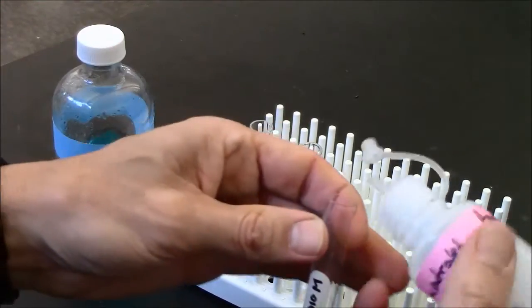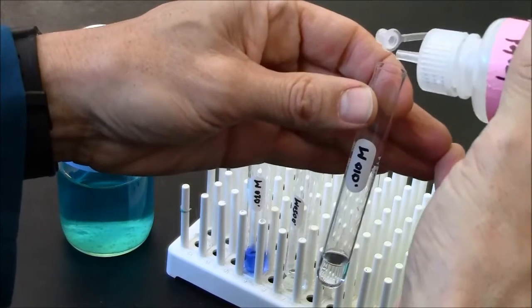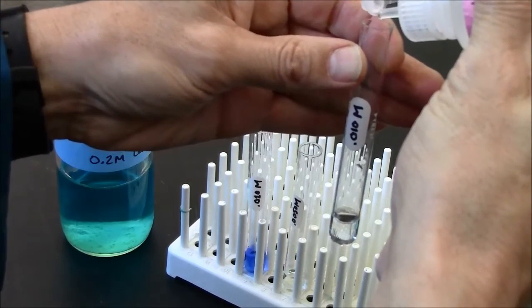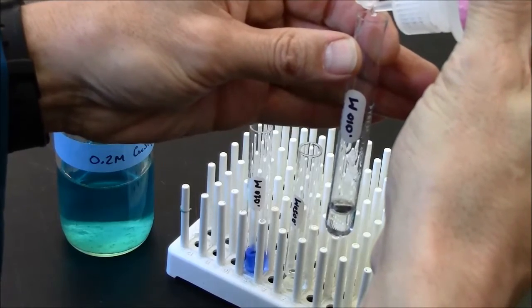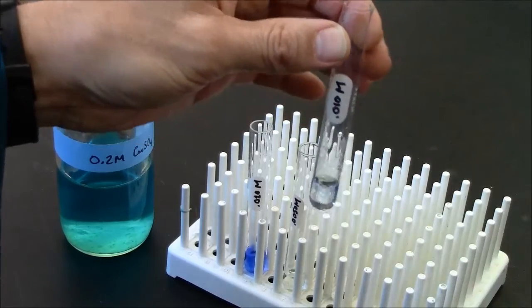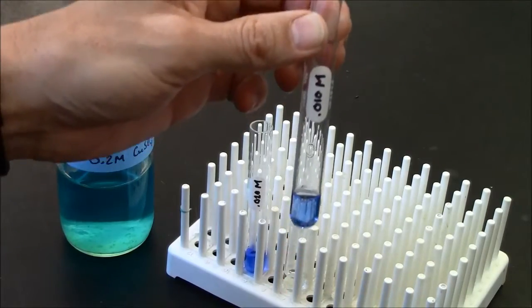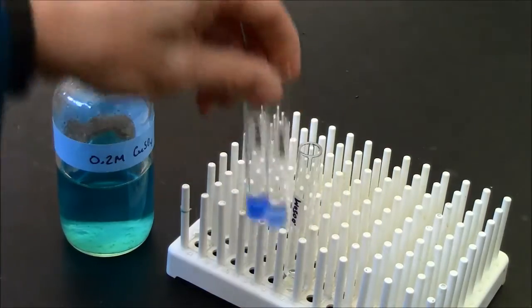And I'll try half that concentration. Same procedure, five drops. So that's blue, but not as intense a blue as the previous.